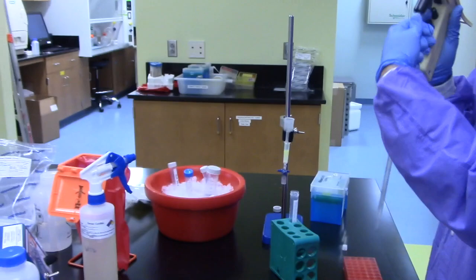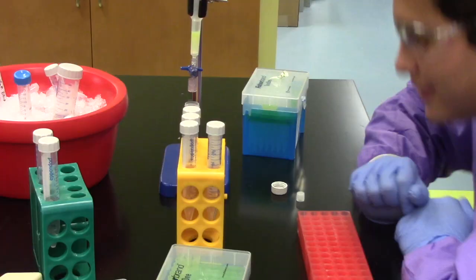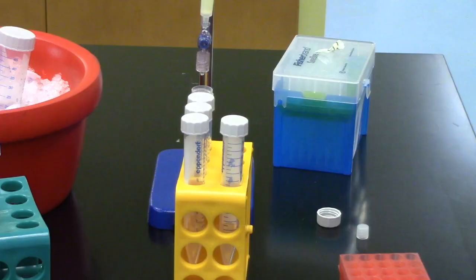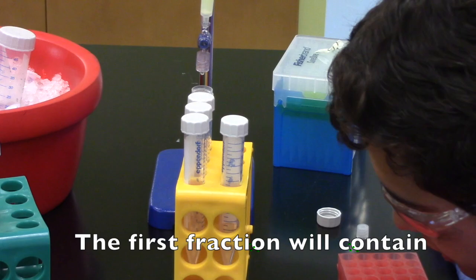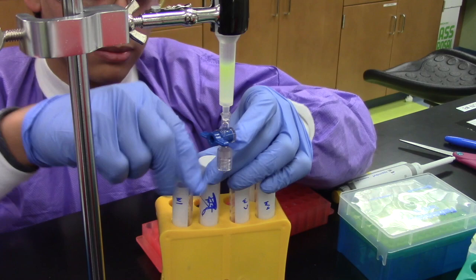The flow through from this step will be collected in fractions. The first fraction will contain the greatest concentration of protein. There will be decreasing amounts of protein in each subsequent fraction.